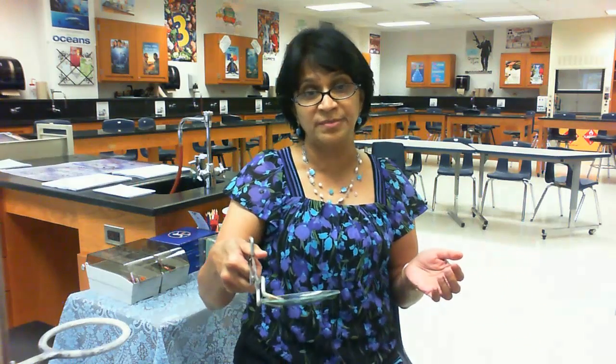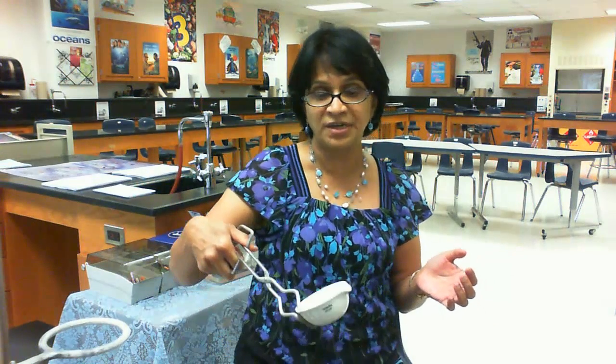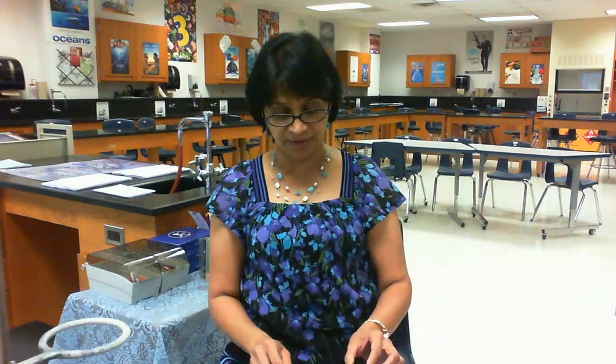Can we use crucible tongs for lifting other things? Yes — we can also use crucible tongs to lift a watch glass if it is hot, or to lift an evaporating dish. Basically, they can be used for lifting any hot objects that are difficult to grasp.